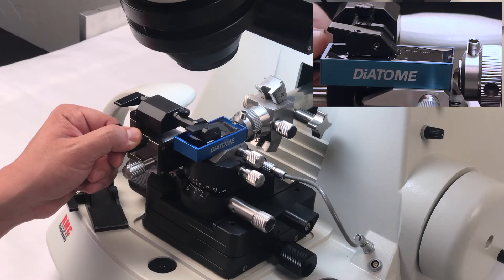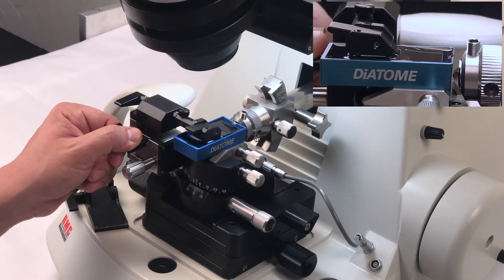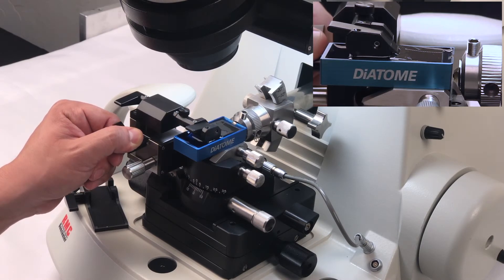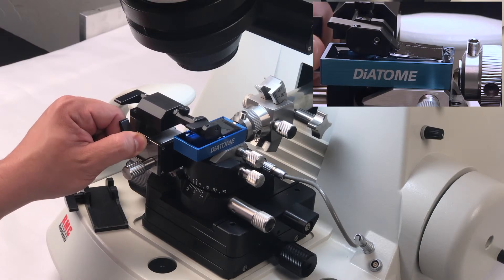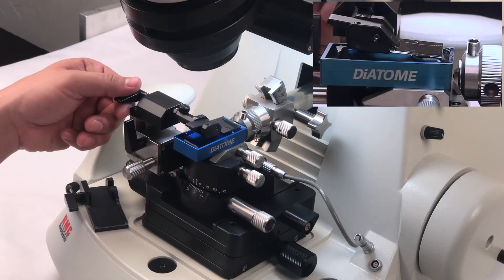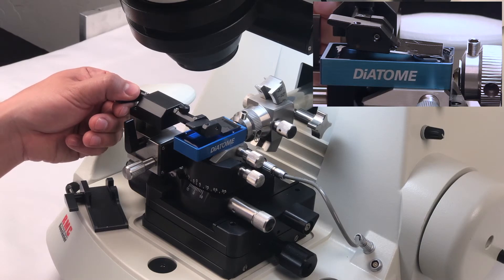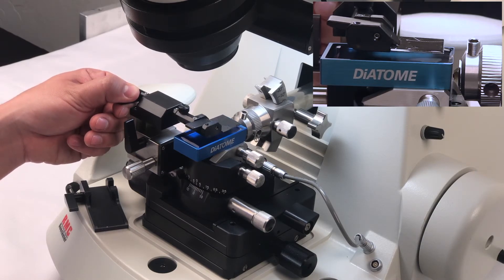So slowly come off, looking at your ribbon through the stereoscope, make sure that it's not moving too much. Lift it up and maybe tilt it up a little bit too, since there is a little bit of water tension.